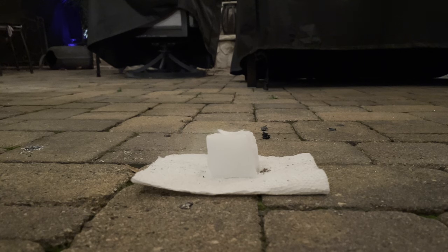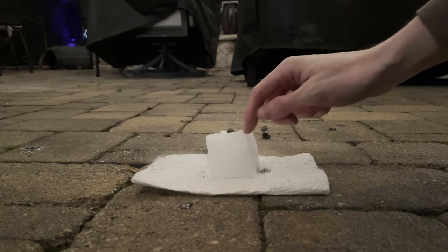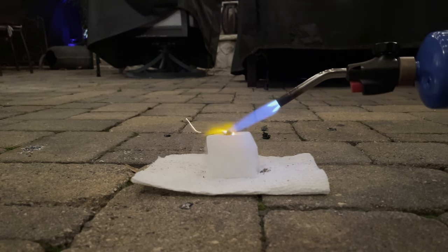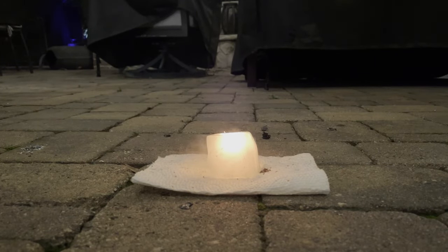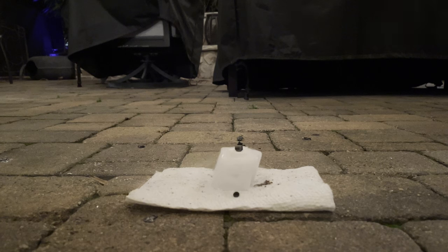Now we're going to move on to the last metal that we're going to test — that's going to be lithium. Lithium has the highest reactivity of any metal on the periodic table. Its redox potential is over 10% higher than that of sodium, so we should see a very good reaction. That was a beautiful reaction, especially with the little sputtering sparks at the end — that was probably the lithium boiling and shooting off tiny little droplets. What's interesting is that the very strong red color of burning lithium was drowned out by the white color, probably due to the sheer heat of that reaction.